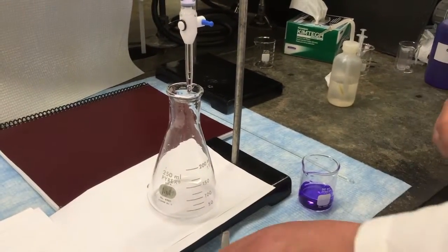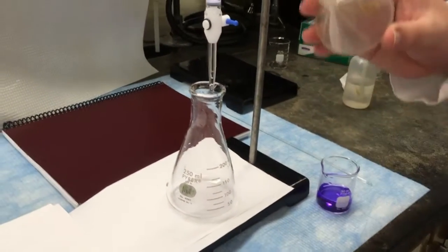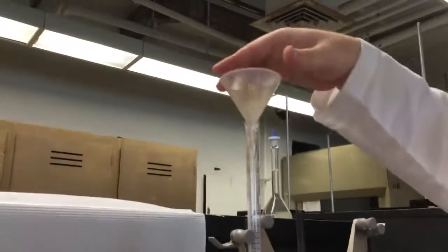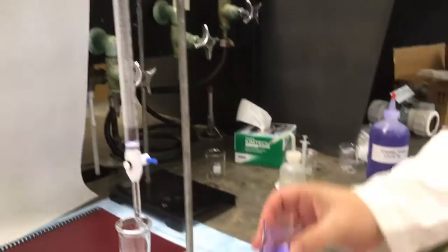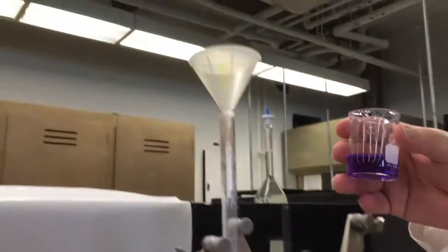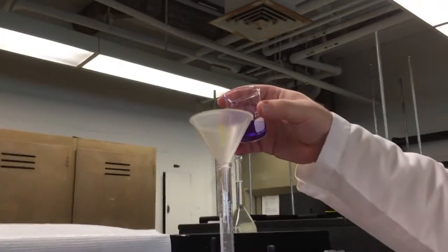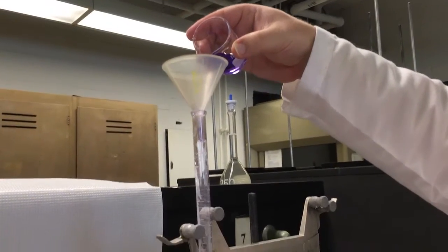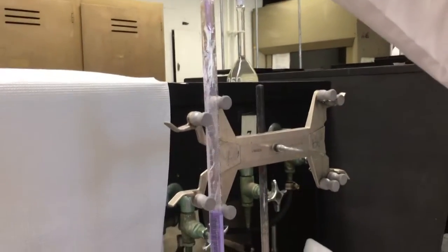Okay, so I've got some purple dye here. I'm going to show you how to load and use the burette. First order of business is to load it, get some solution in there. So we'll use a funnel to load it. That's much easier than trying to pour into that narrow neck. You won't spill solution everywhere. Just got some purple dye here. Just pouring that in. We'll let it fill up.